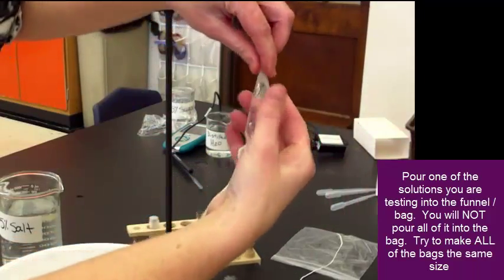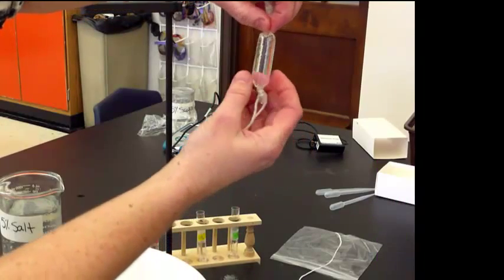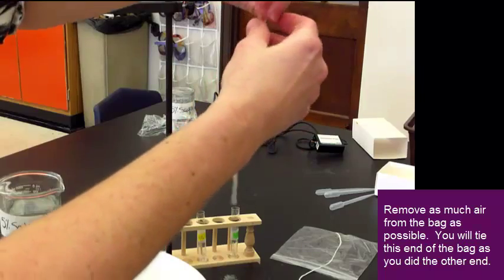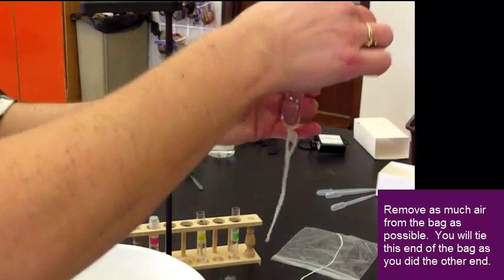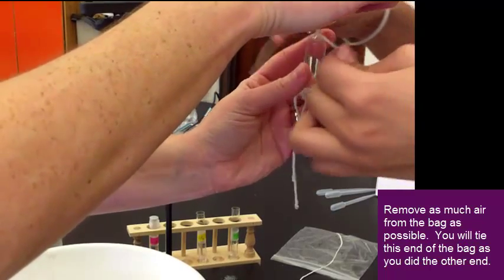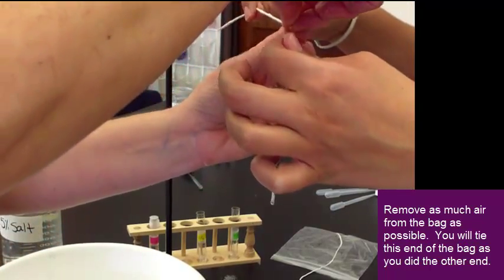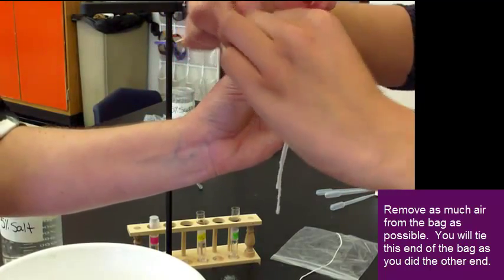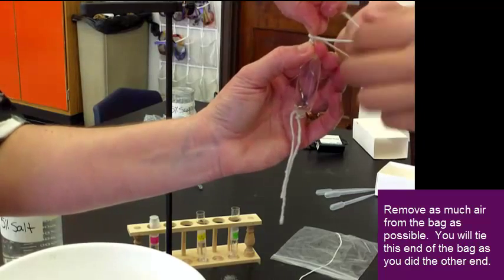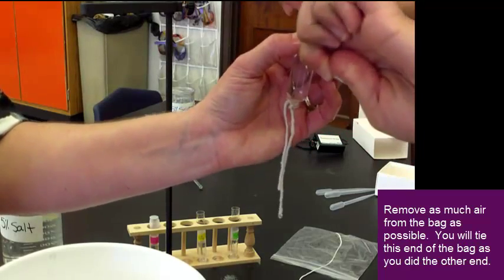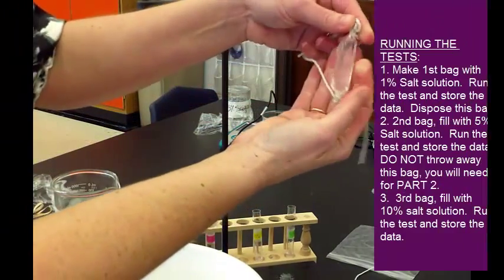That looks good. And I want to get out as much air as possible. Make it firm. Try to make the bags about the same size. So, I twist it. Now, my partner is going to wrap the string. And I'm going to fold over the top and hold it. She'll wrap it again, and she will double tie. Perfect. So, then I have my little bag.